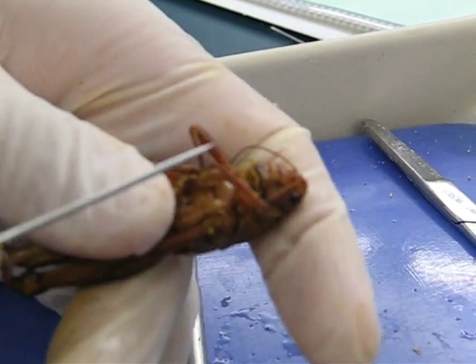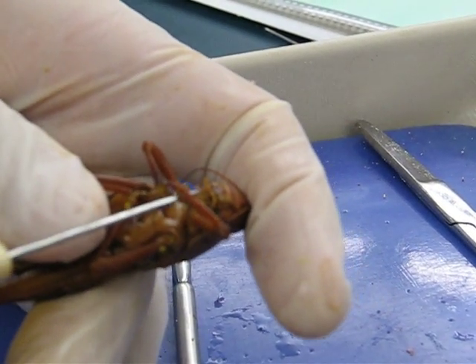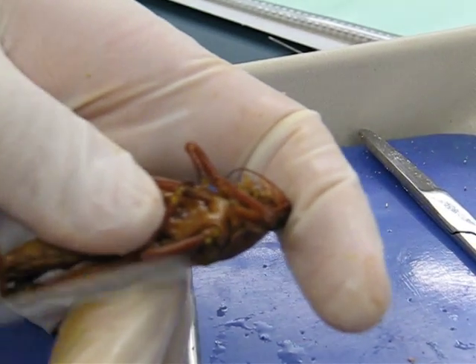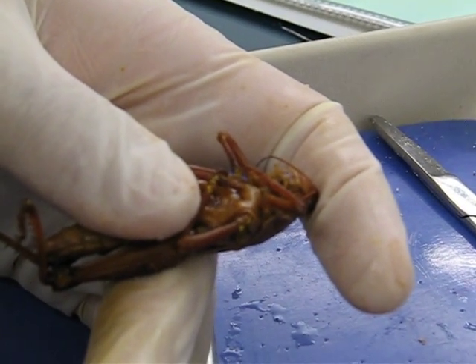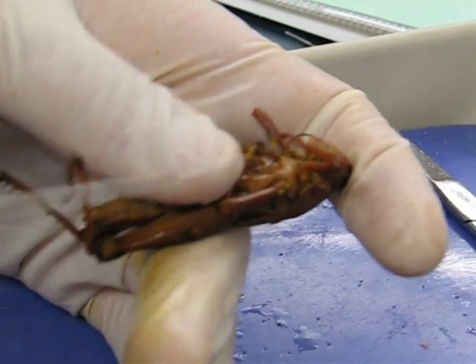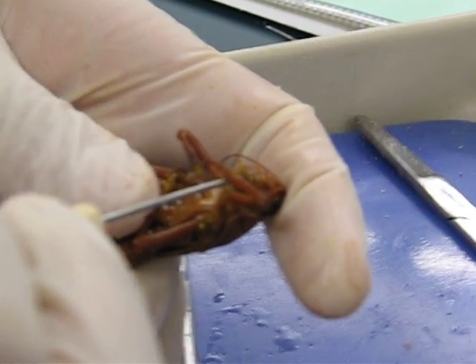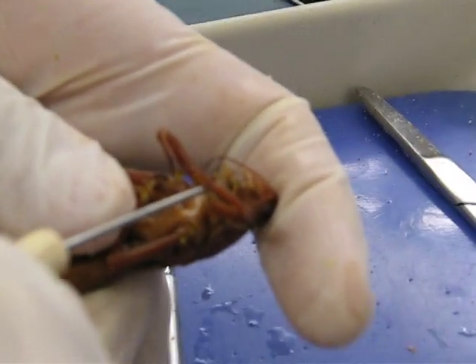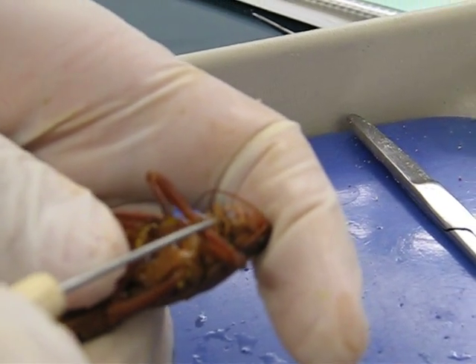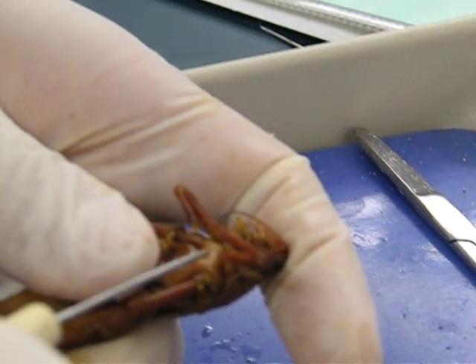Maxilla with palps. Maxilla with palps. Wait — Maxilla? Maxilla is this one in here. Palp is this. I'm trying to figure it out.